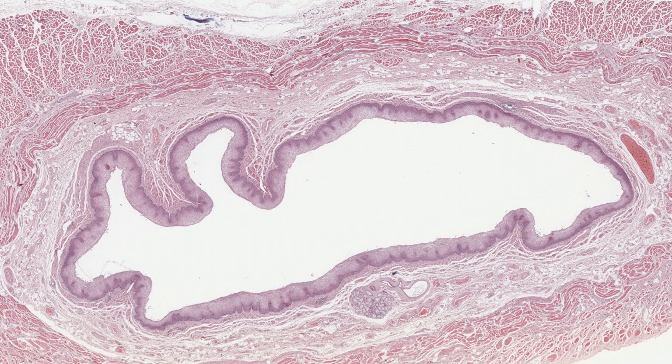It happens to be a section through the esophagus, but the esophagus is partially constricted, so the wall is thrown into folds. So here's the lumen, and so this is a surface that I'd expect to be lined by an epithelium. If the tissue has been stained with hematoxylin, the high density of epithelial cell nuclei often reveals the epithelium as a purple line or mass.